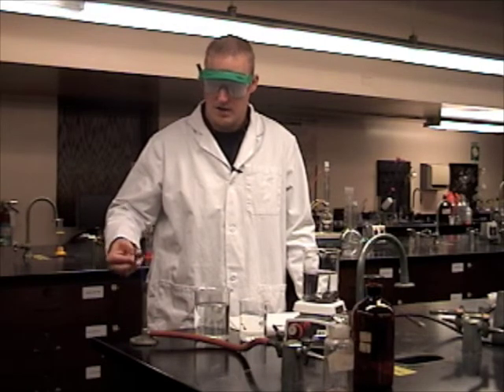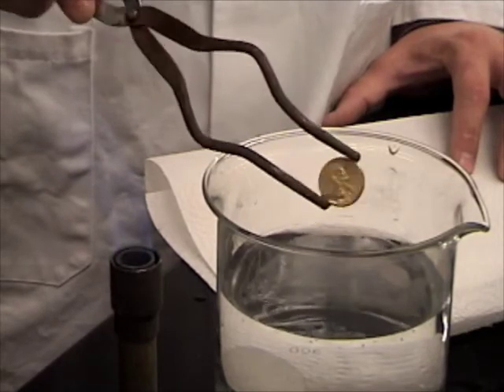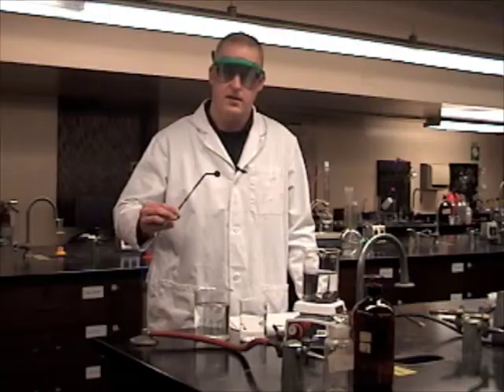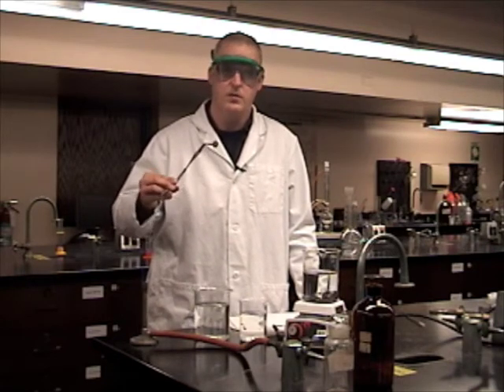Going to start to turn colors and then we're going to superheat it in the water, supercool it. It's going to come out super shiny. There you go. We've got a gold penny.